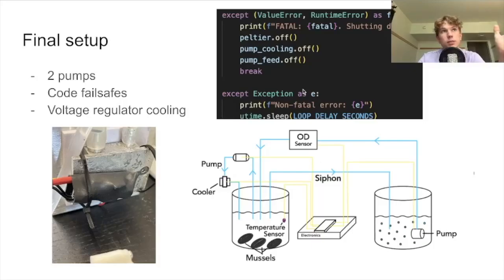So we've achieved high quality electronics by organizing and working with the lowest length of wires needed. The breadboard is therefore very clean, which is optimal for working conditions and debugging. We've chosen to elevate the main electronic component by gluing a cardboard plate on the box and zip tying the loose wires onto the cardboard box, eliminating all risks posed by possible water spilling.